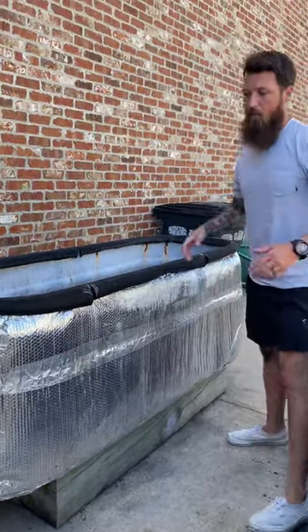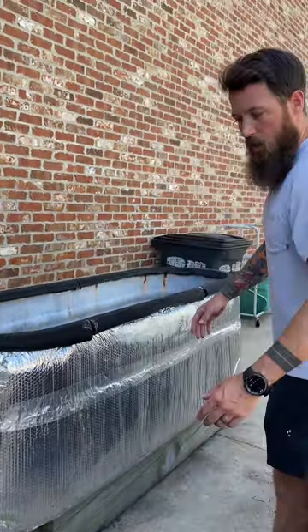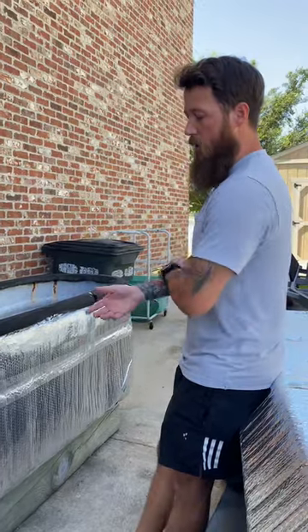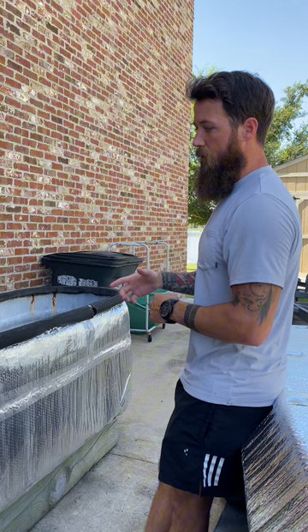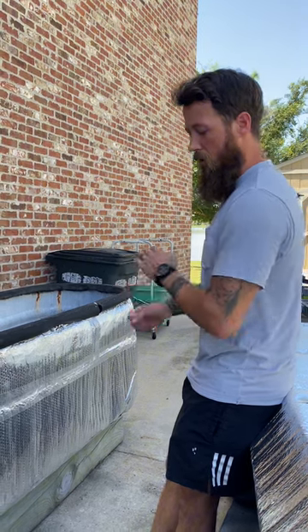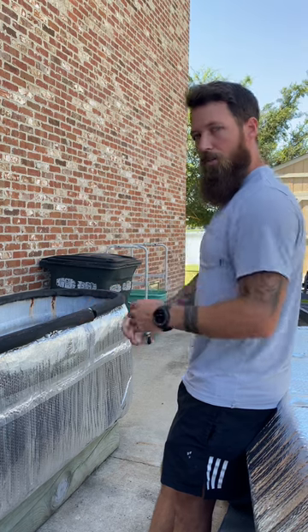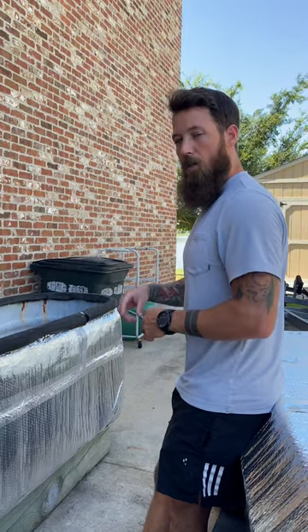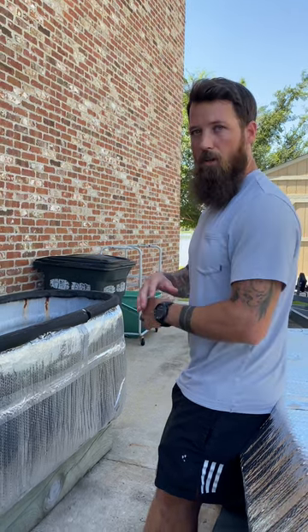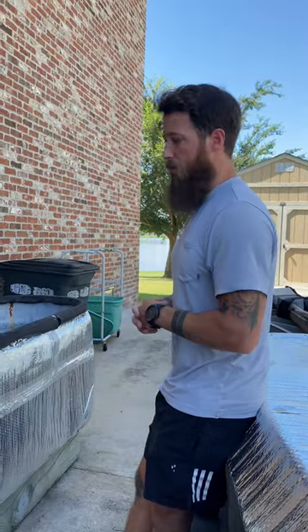It's really basic — just a boiler and a vessel that you put your stuff in. This gets up to about 211.8 degrees and we run it for a few hours. Essentially we make our bags, fill this up, turn it on, it gets to temp later that evening, and the next morning we come in and shut it off.